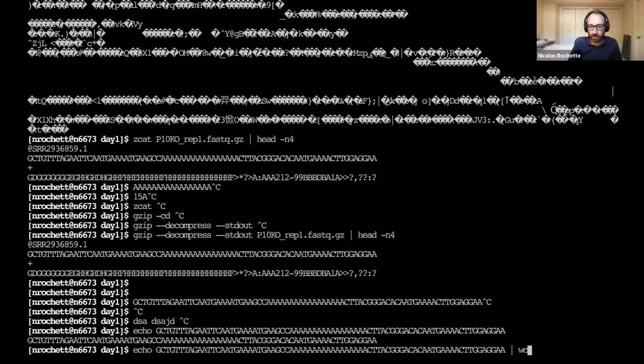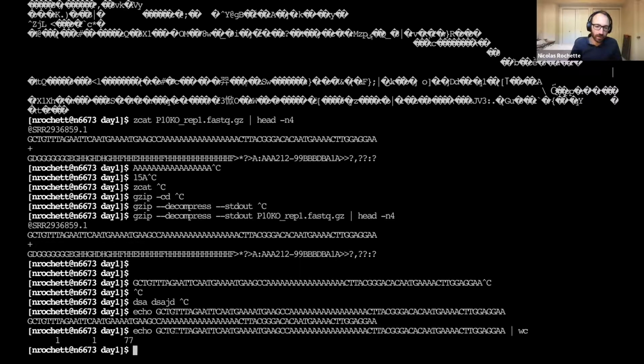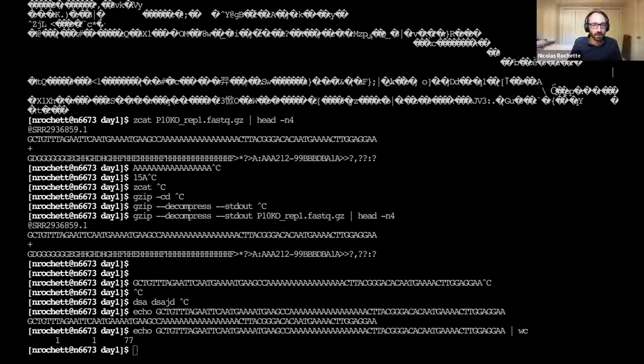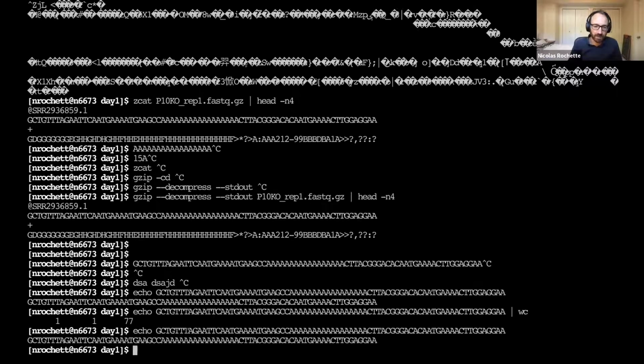And so we do this echo and then WC. And so we get this. We get one line, one word, because we don't have any white space, and then 77 characters. Does this match the number we had in the table? No. We had 76. Actually, the reason is there's a new line there. When echo prints the argument that we gave it, it adds a new line at the end.